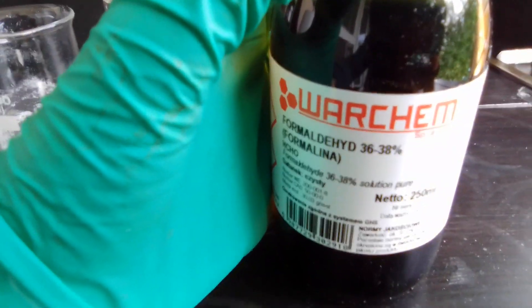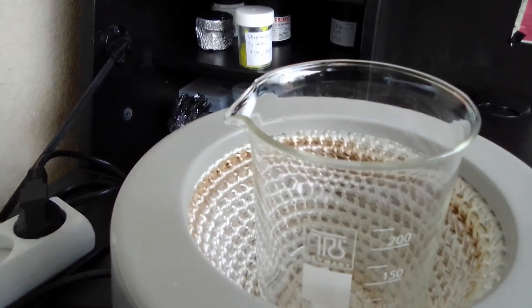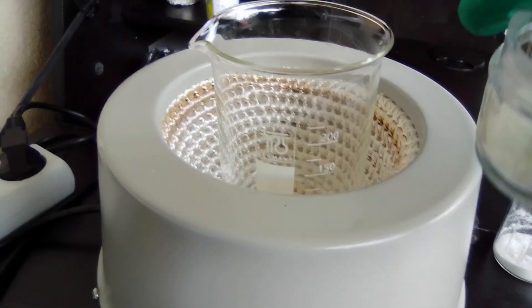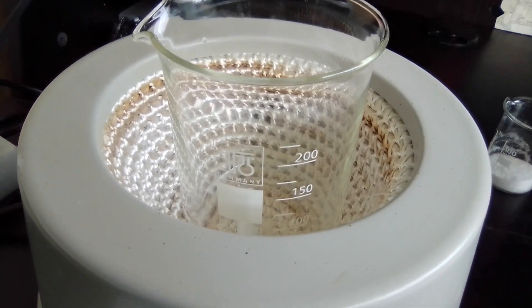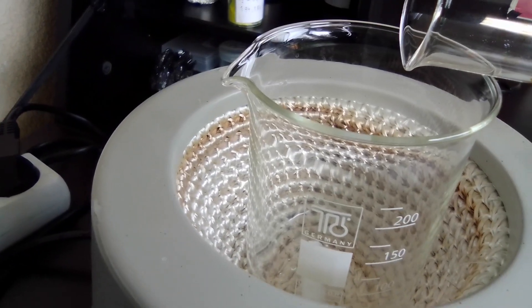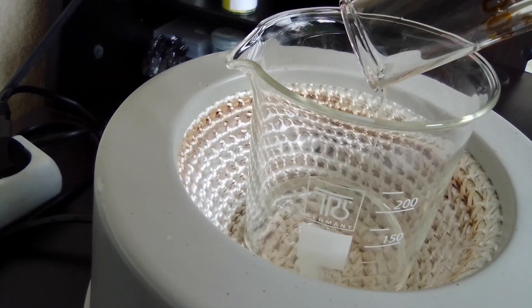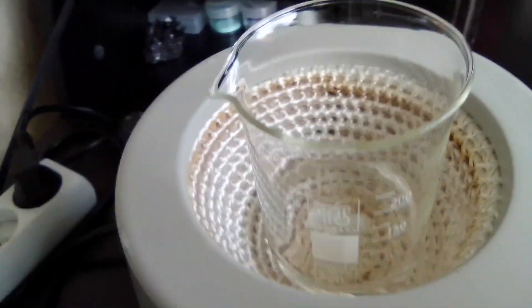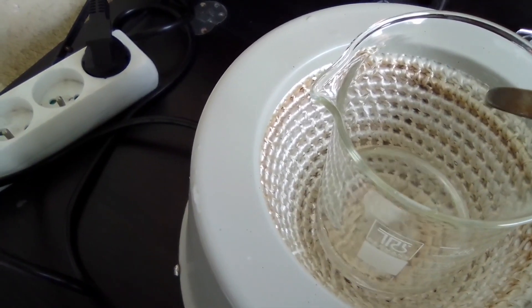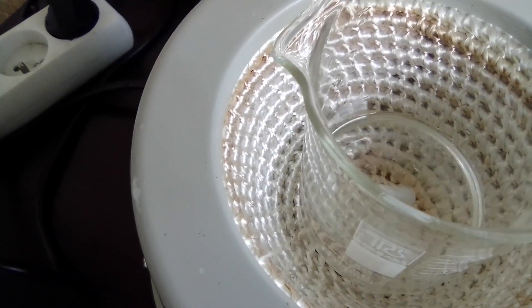The formaldehyde should be about 38 percent. What you should do now is add the nitrite to the sulfuric acid slowly with strong stirring to avoid excessive pollution of nitrogen oxides. Here goes the sulfuric acid, and I'm starting off pretty slowly — as you can see, it's pretty calm actually.